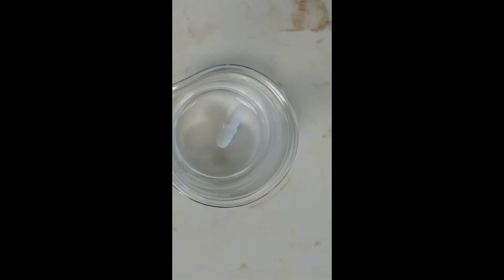All right, this is experiment 2. In this beaker, we have 1 milliliter of starch, 2 milliliters of thiosulfate, 1 milliliter of water, 4 milliliters of iodide. We're adding water now to try and keep the total volume for the reaction constant. Okay. Are you ready to record? Here is our 5 milliliters of persulfate.